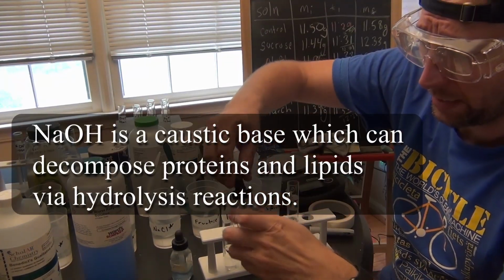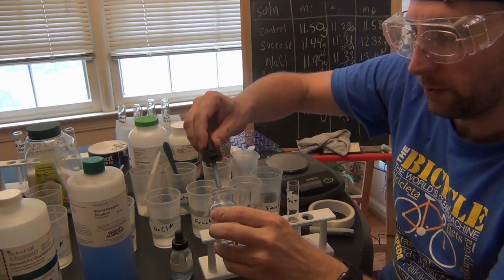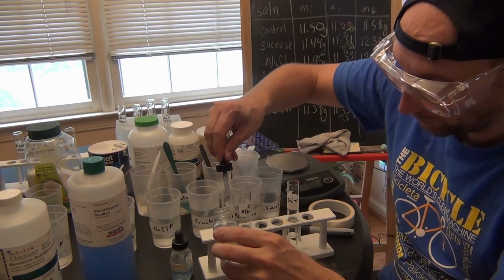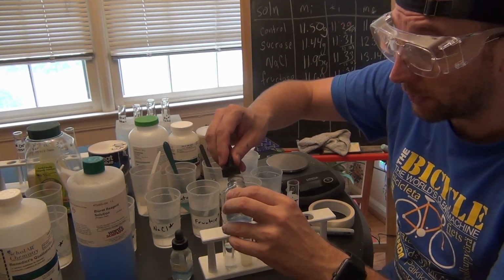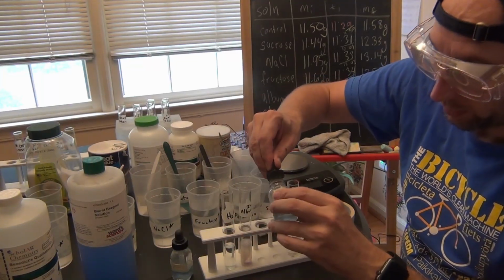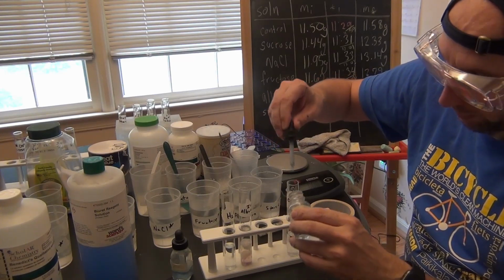And I'm just going to add a whole dropper worth of Biuret solution to each. Now the water acts as my negative control here, so I can see what it looks like without anything. And it was what was originally on the outside. The albumin will show me what it should look like with proteins. And I should be able to compare to see what's outside now.